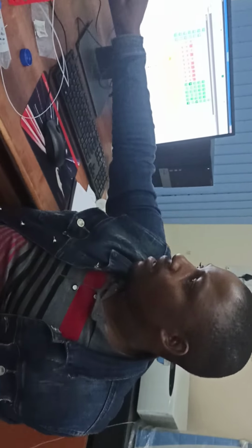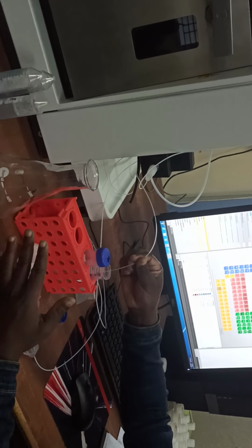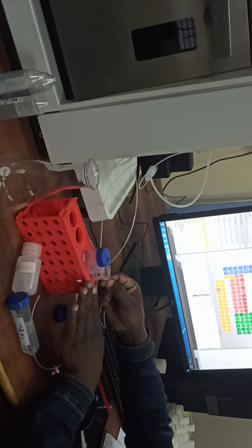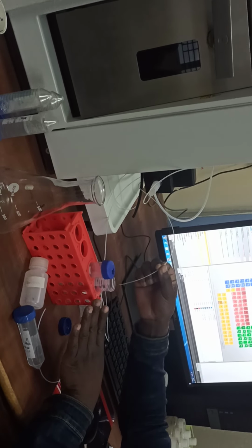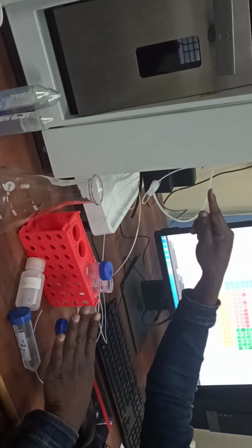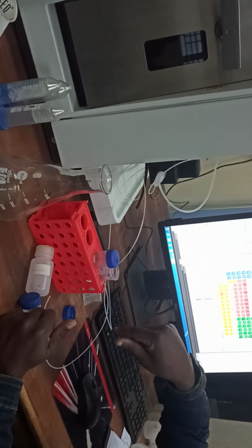And you can find here the place where I placed my sample. This is the tube, we call it the sampler, from where I can, during the process, allow the instrument to suck a particular sample and take it into the torch, from where it will be ionized into atomic ions and their concentration easily detected.